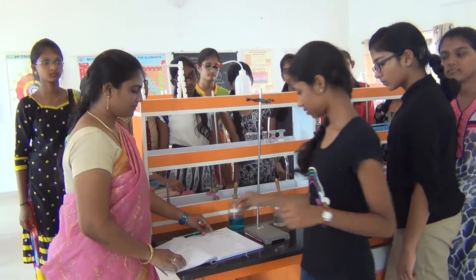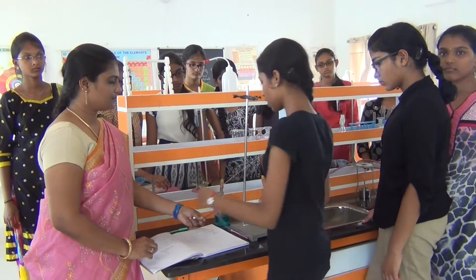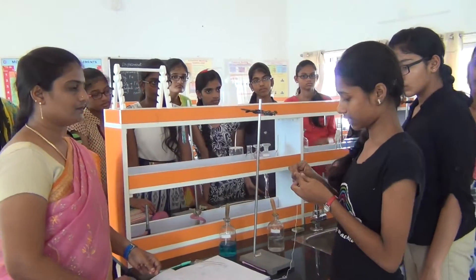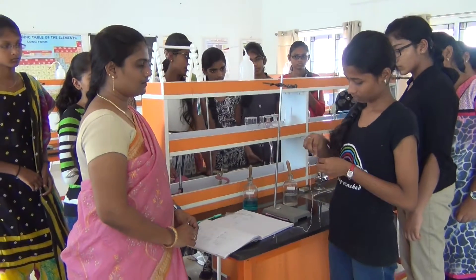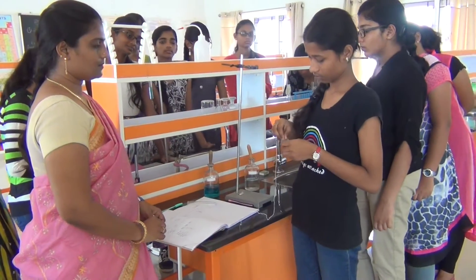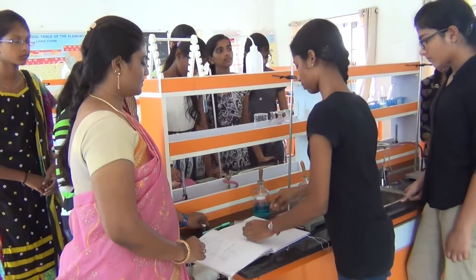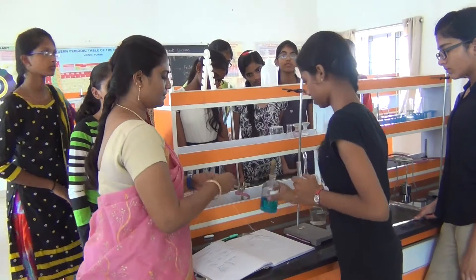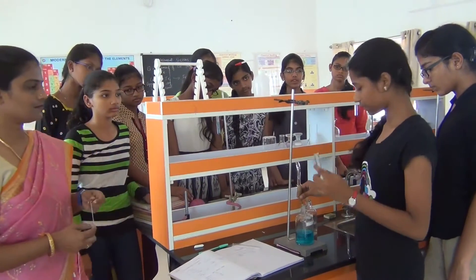First, we should tie this iron into the thread. Now we should add copper sulphate solution to half of the test tube.